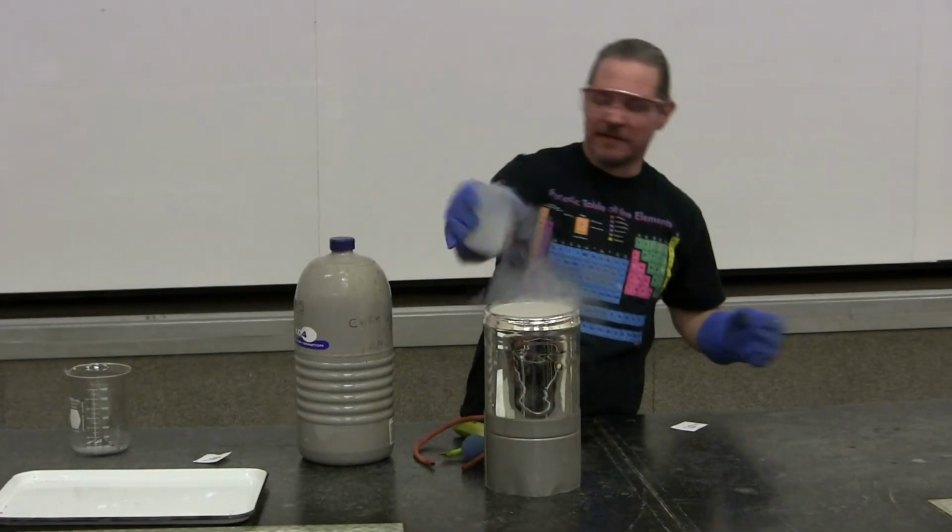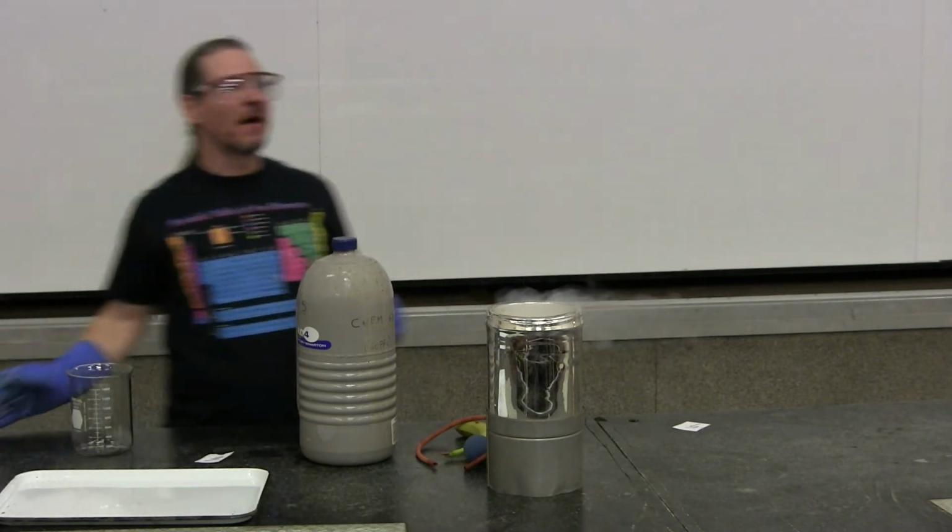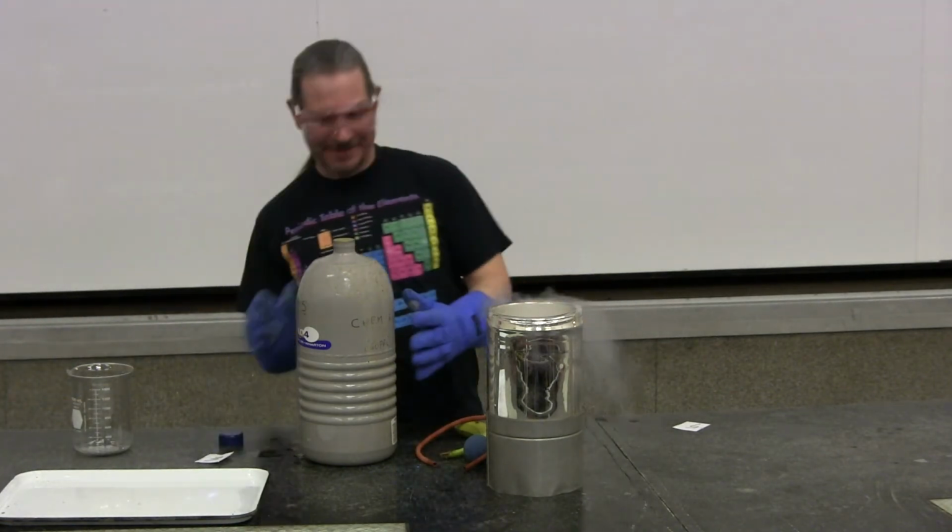So, you saw what happened when you put a flower in liquid nitrogen. Let's put a whole bunch of other things in liquid nitrogen. See what happens.